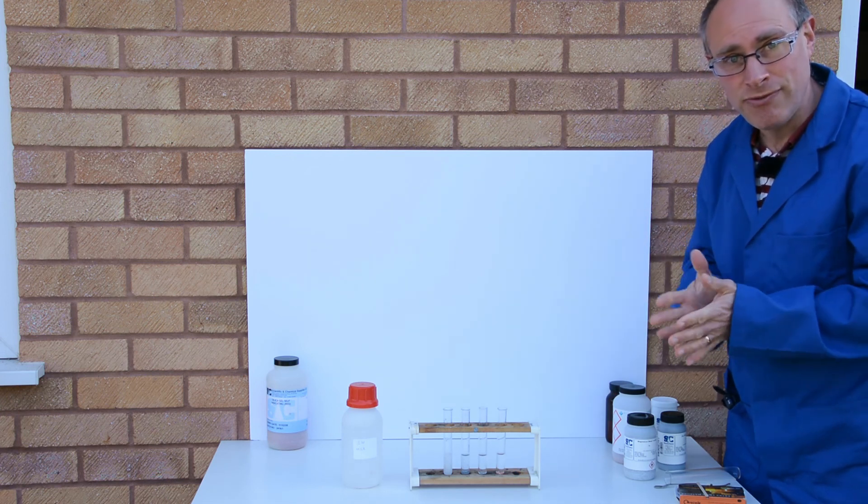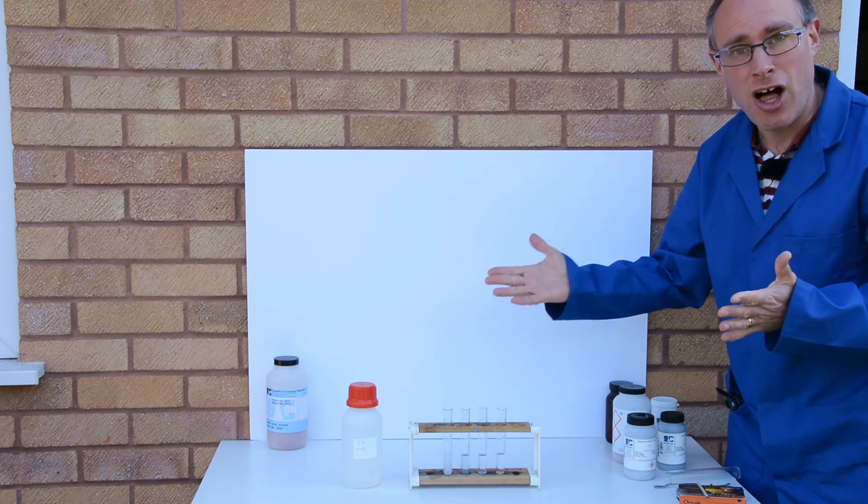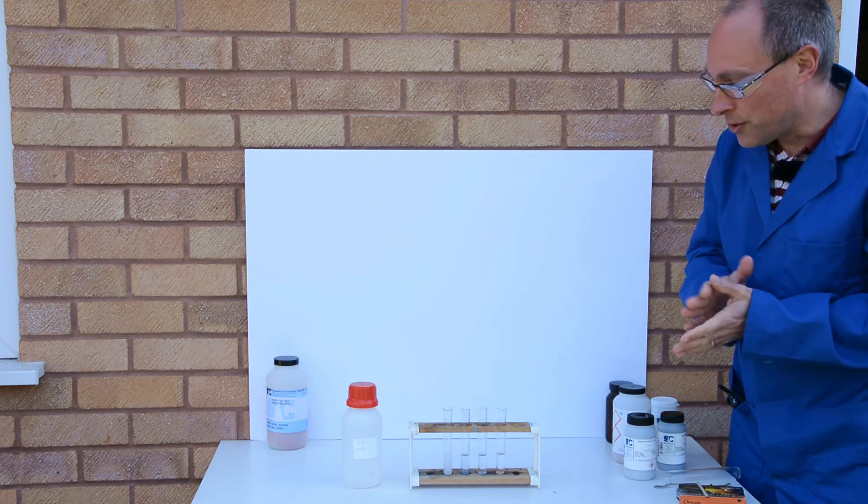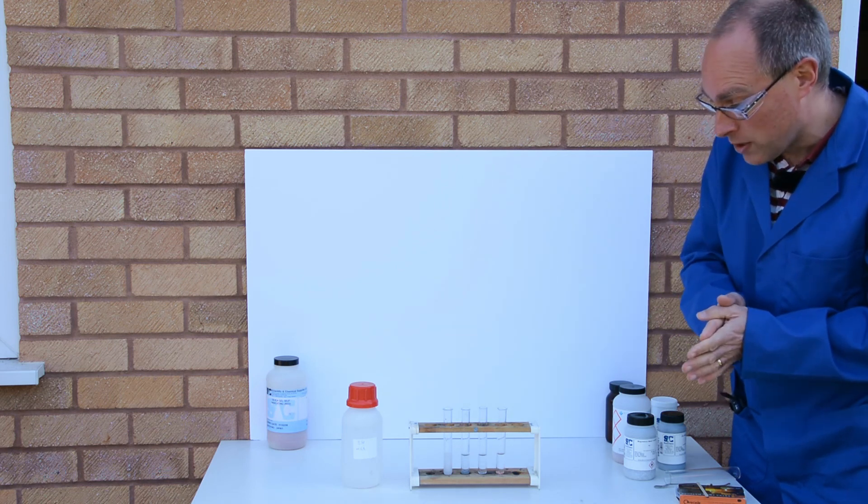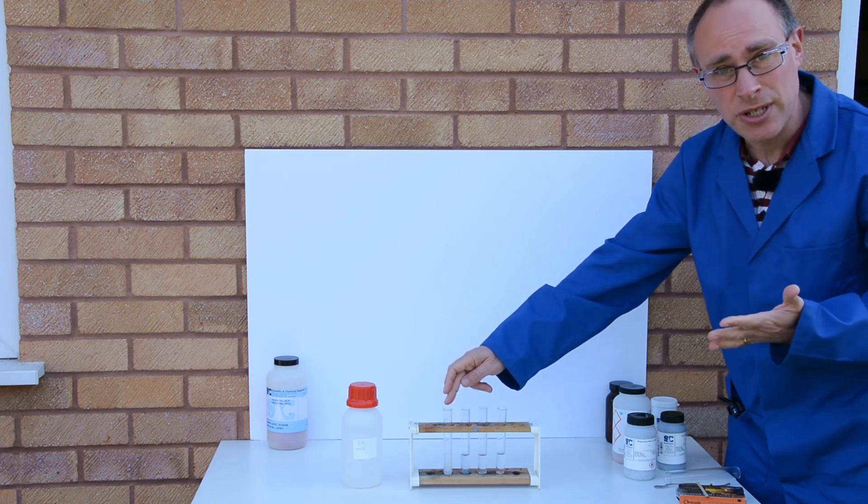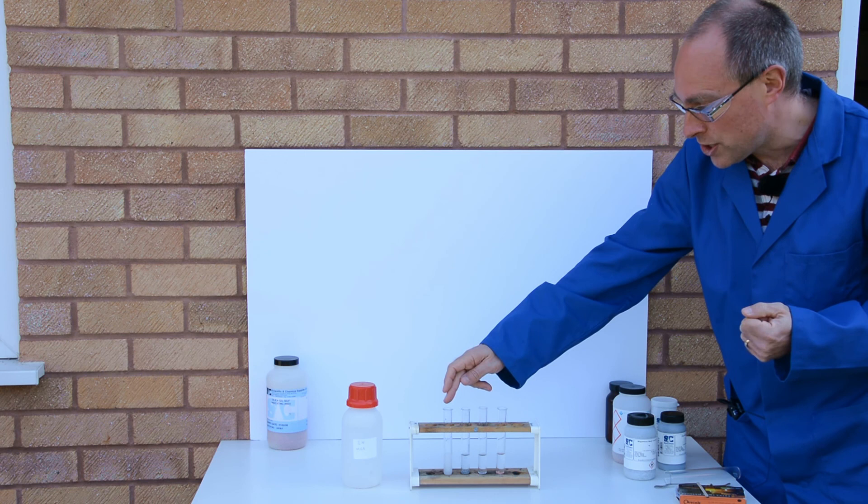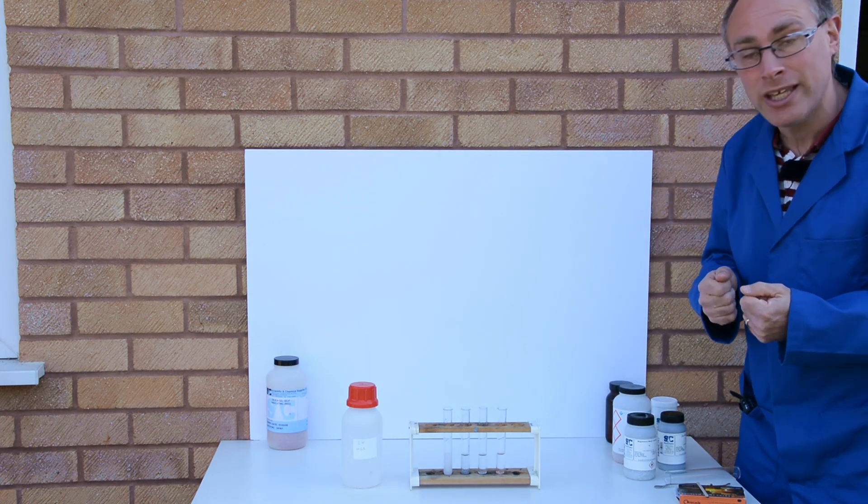We saw in a previous video that with water, magnesium hardly reacted at all, although it did react with steam quite quickly. So magnesium then is the slowest metal reacting with water that we observed, but the fastest of these four with acid.